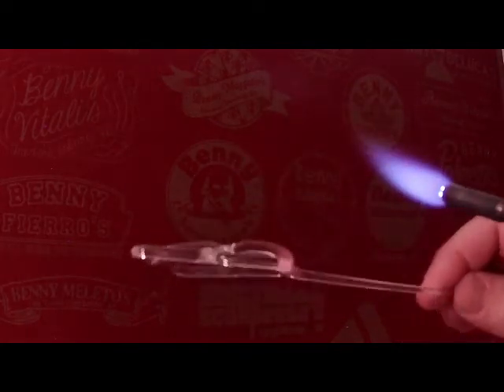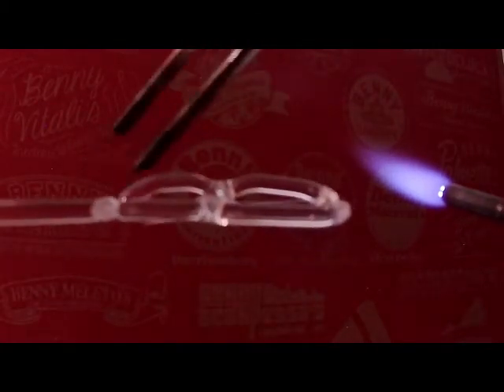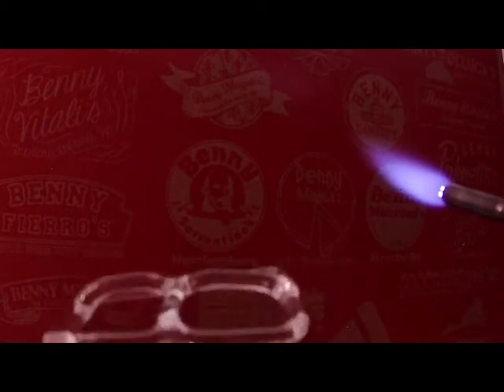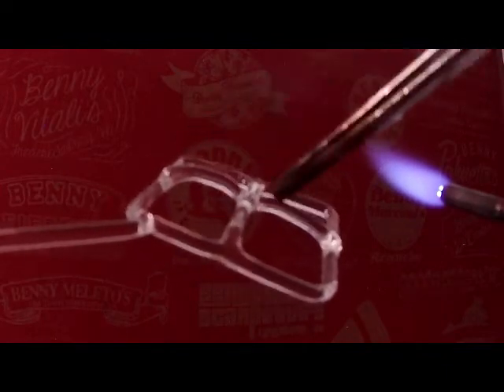And as you look at it from an angle, you can see how it's kind of coming up over the plane of the square. So if I wanted this to be perfectly level, I could heat these two glass rods and move them into the plane. Probably the easiest way would be with the tweezers. But honestly, I'm okay with how this is set up.